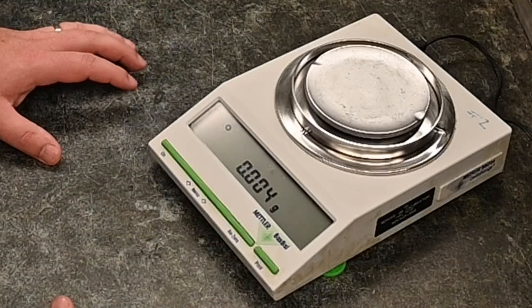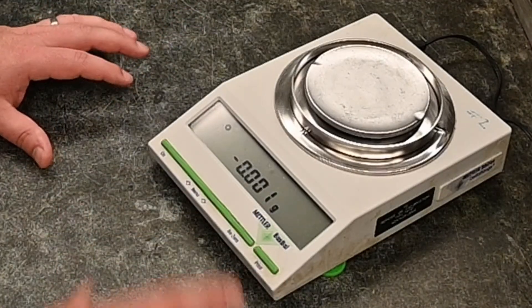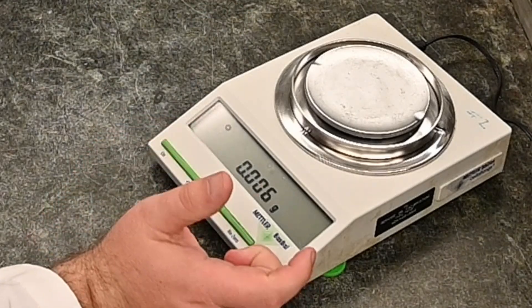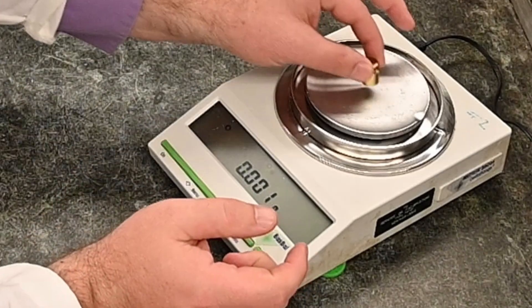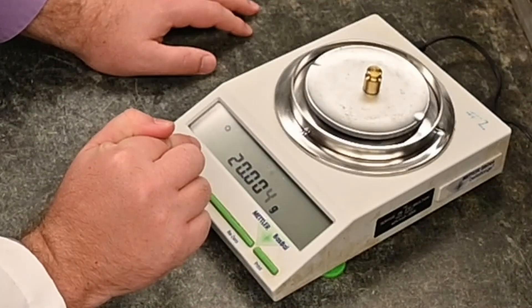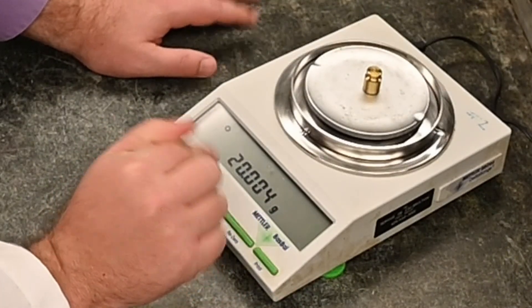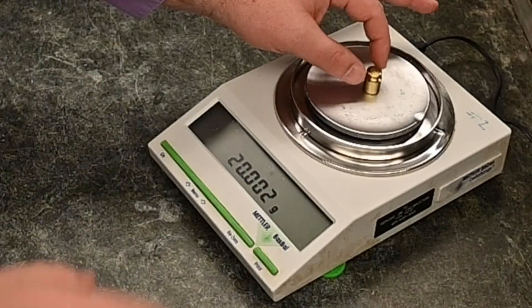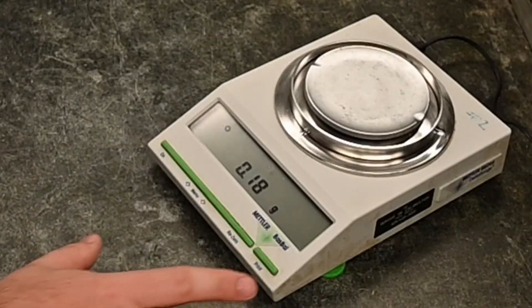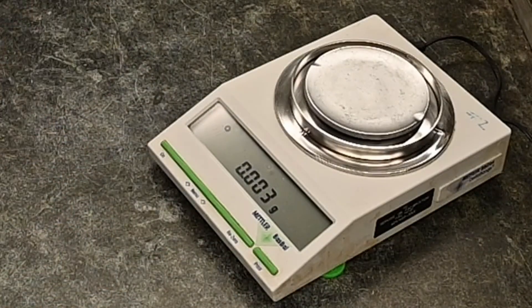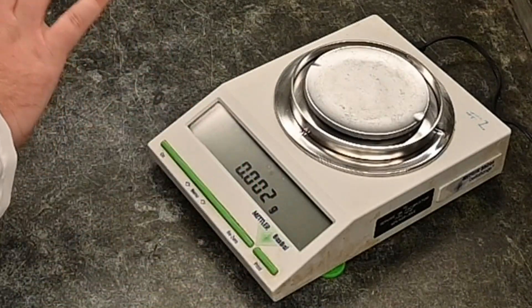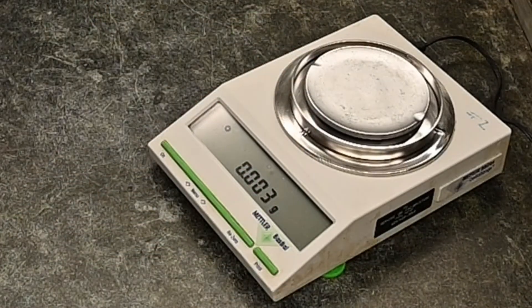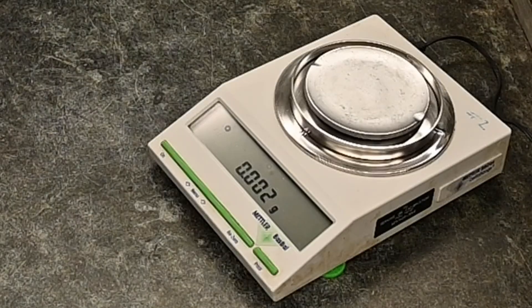Let's take a look at this fancy guy right here. First thing you'll notice with the fancy guy is there's a lot more numbers. Whereas before it just read 20 grams, this thing is now going to be like 20.004. So what is the difference? You might say, well, there's more numbers. Well, that is actually called precision. And it gets into this idea of something called significant figures, which is a little beyond us. But you will definitely learn about this later. But definitely something you want to keep in mind.